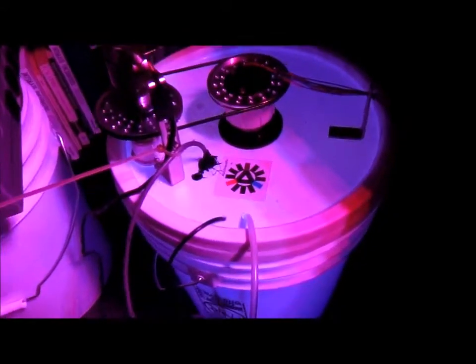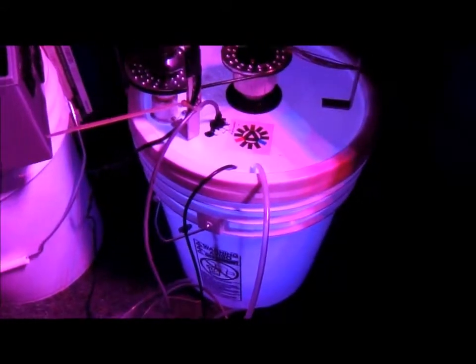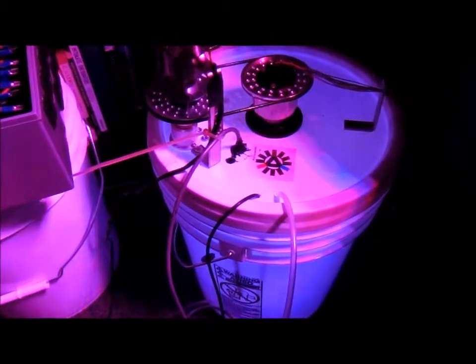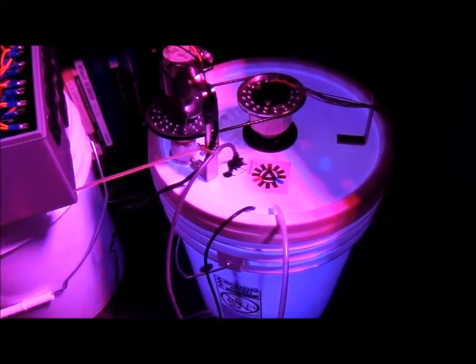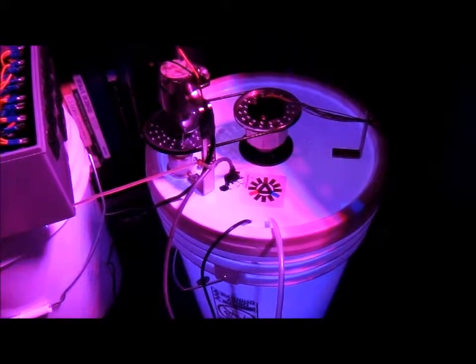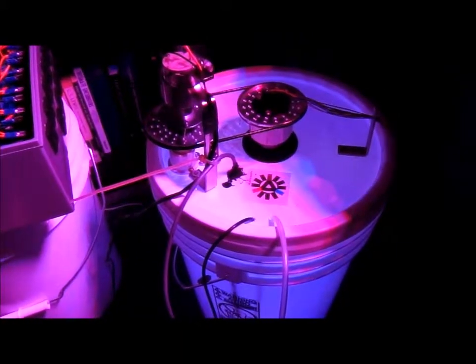So we'll get that done, and then the air pump I already have. I'm just using an aquarium air pump right now. So that's our photobioreactor. It's almost done, gonna look forward to seeing that thing completed.